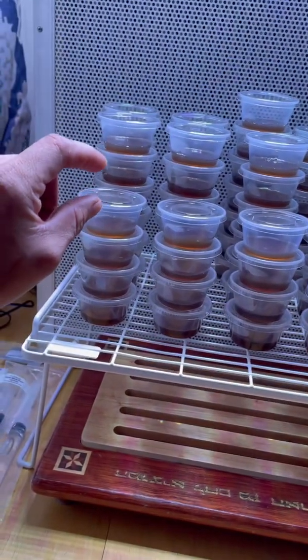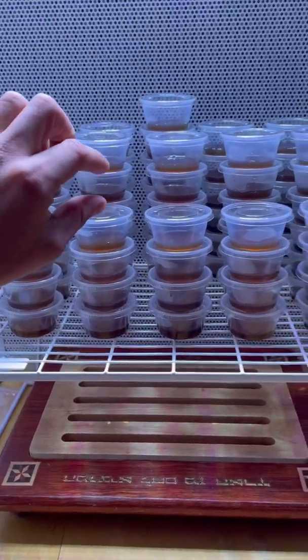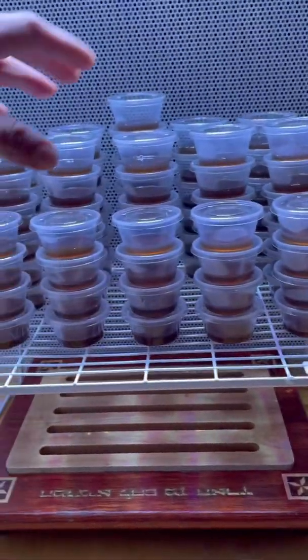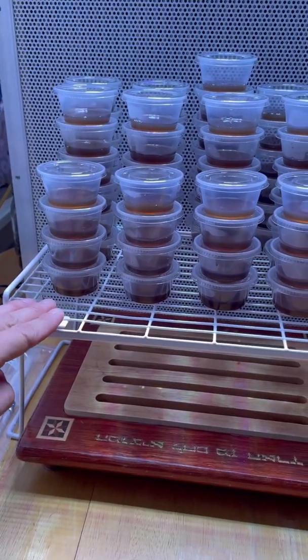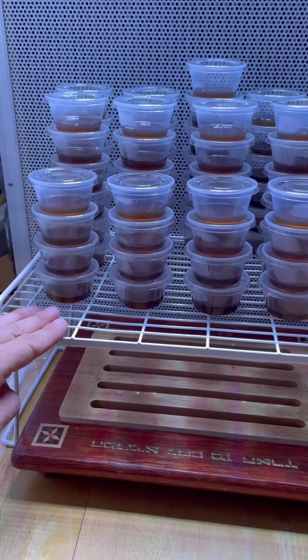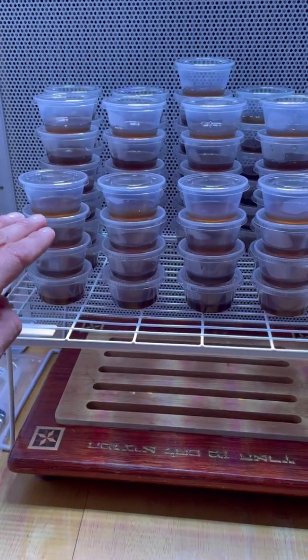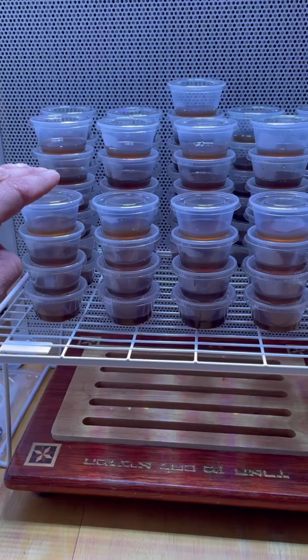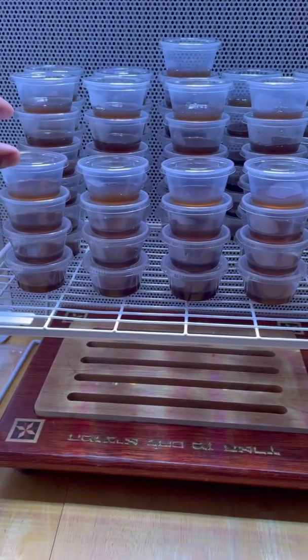You want to put a hot ketchup cup, a ketchup cup with hot water or something, after you're done pouring them. That way the warmth of the cups rises all the way to the top, and the condensation is usually stuck on the one on top.